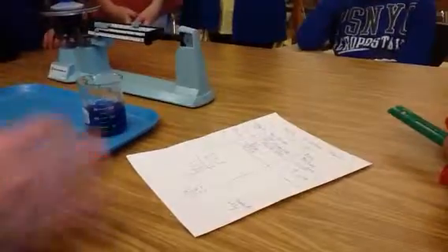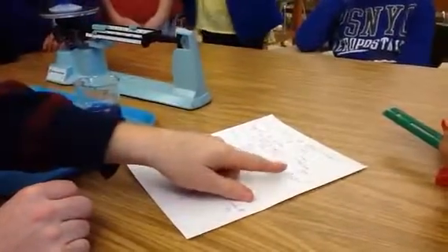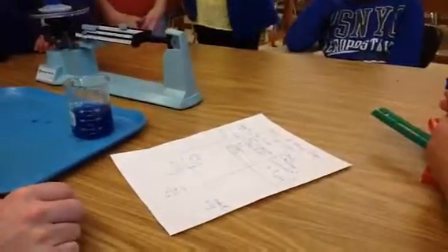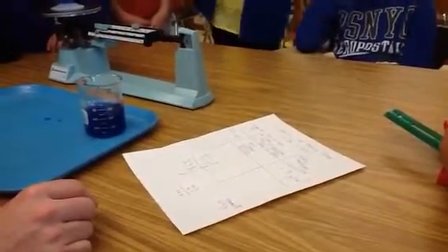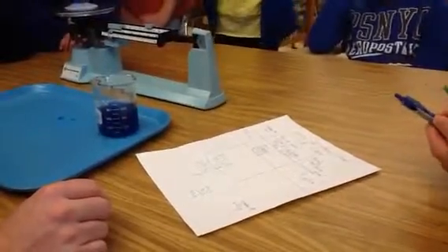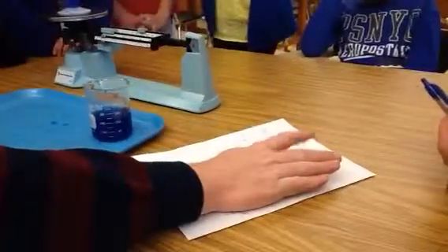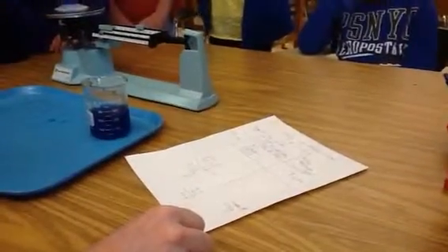We're going to see with the rest of this lab if they all turn out to be pretty close to this, because in a minute we're going to make a prediction about whether you think all the densities are going to be the same or all going to be different. And that's how we find the density of a certain amount of water, which is what we just did.